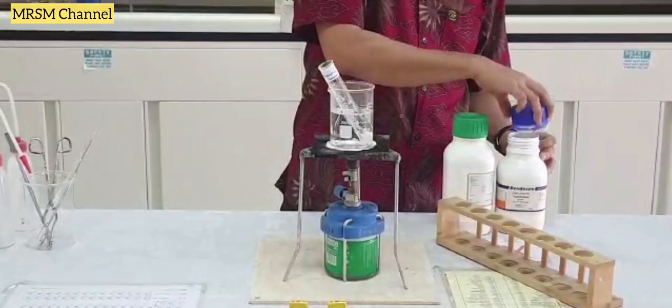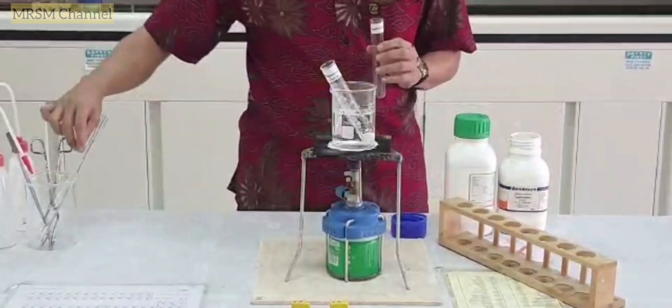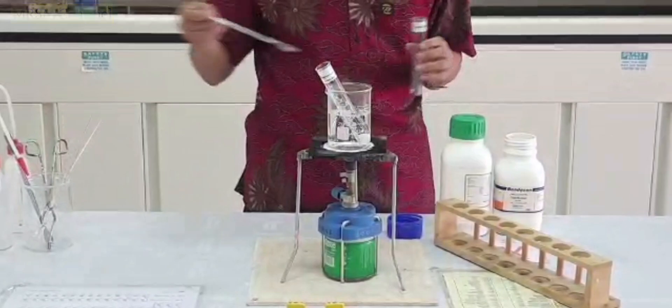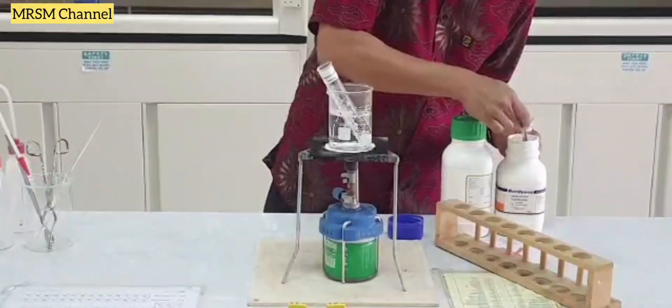Next, take your naphthalene with another set of spatula into the boiling tube.